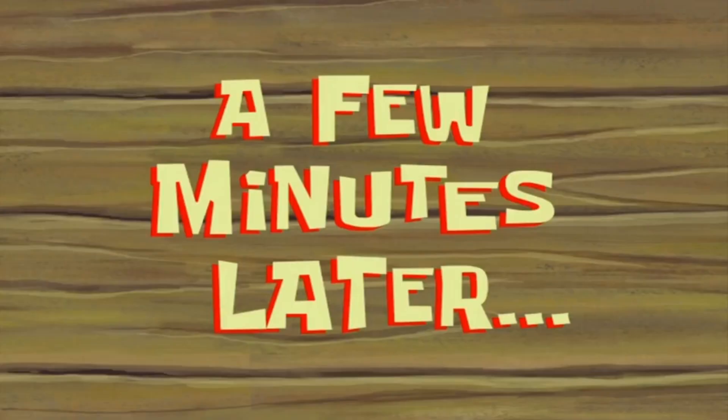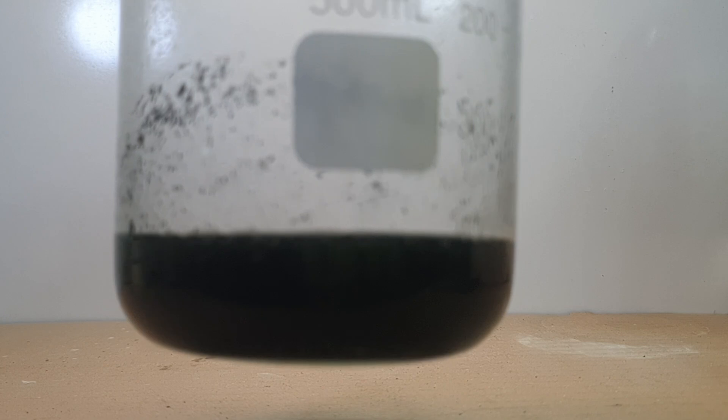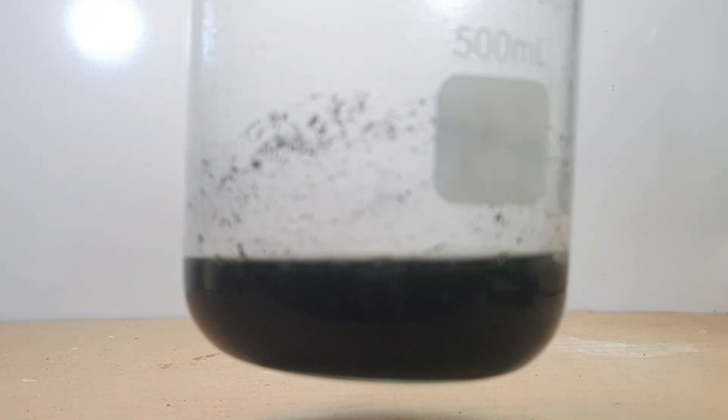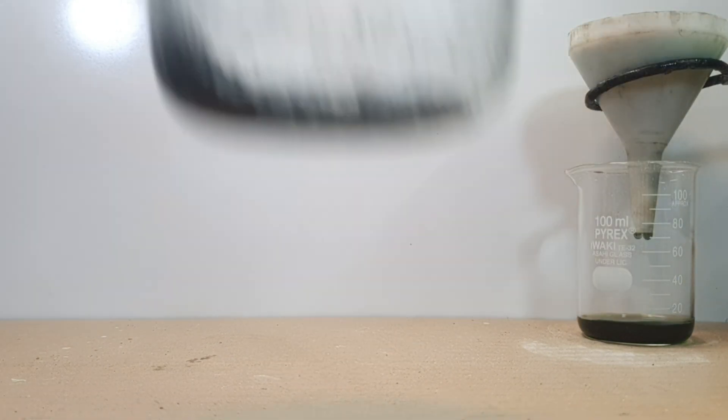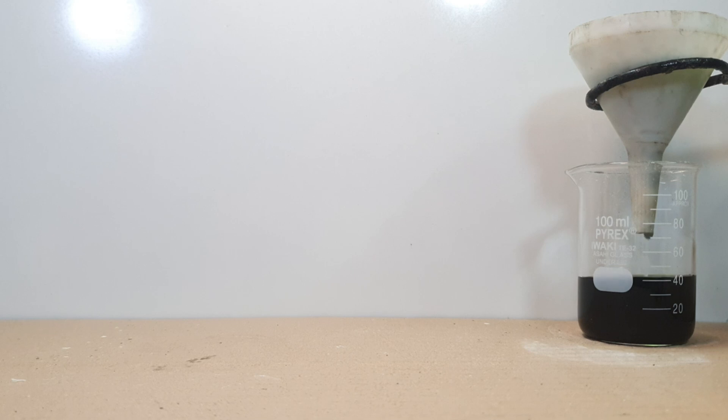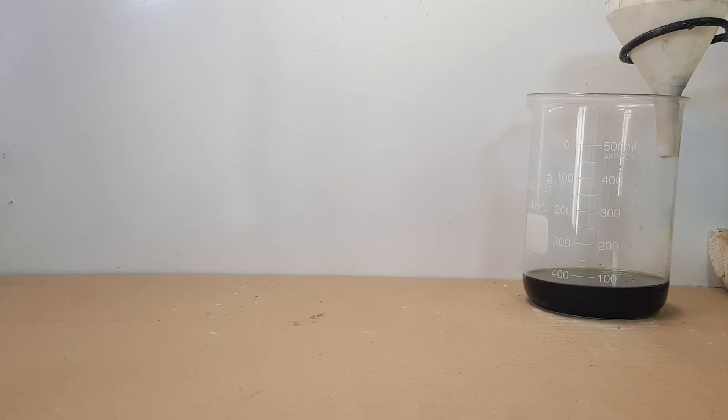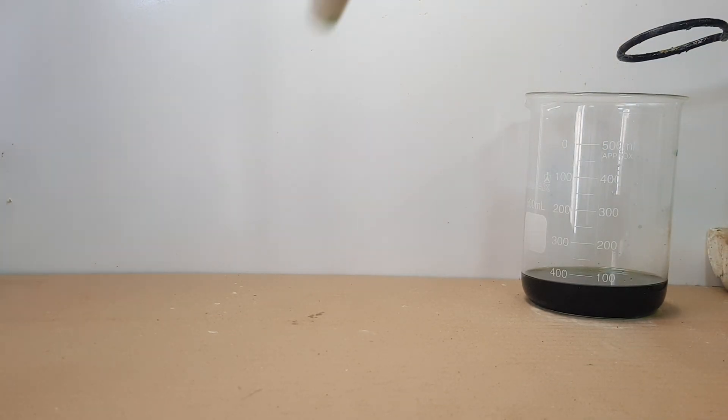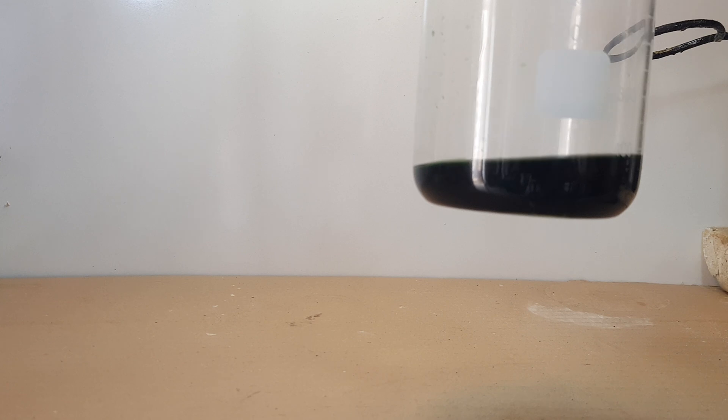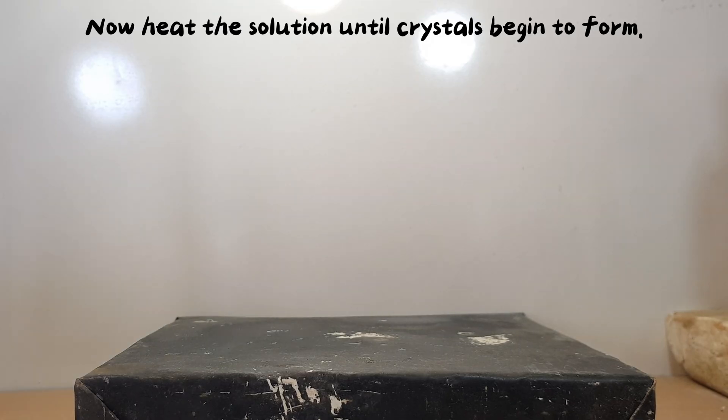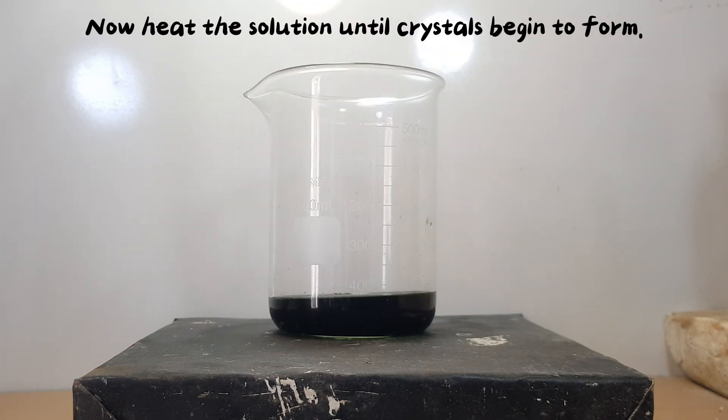A few minutes later. Now heat the solution until crystals begin to form.